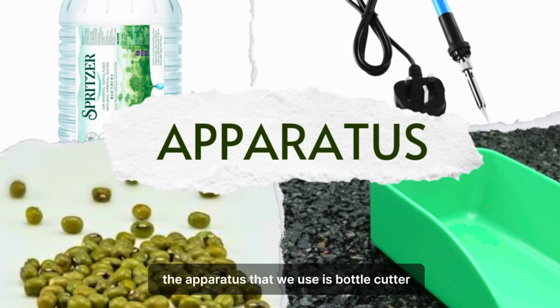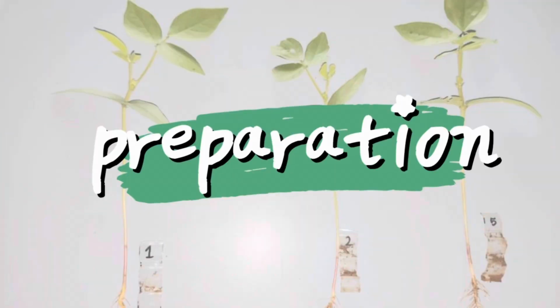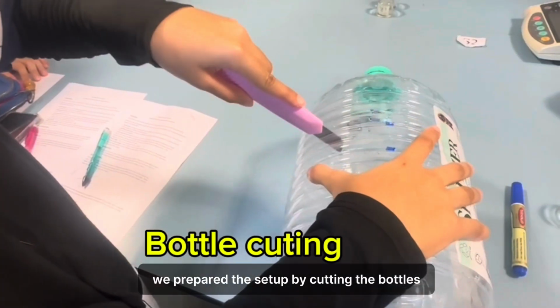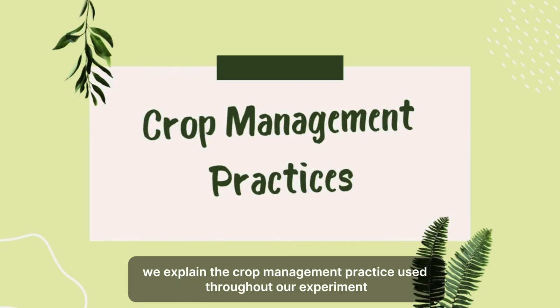The apparatus that we use is bottle, cutter, marker, seeds, scoop, and soldering iron. Next, for preparation, we prepared the setup by cutting the bottles, making drainage holes, and tagging each plant for easy identification. In this section, we explain the crop management practice used throughout our experiment.